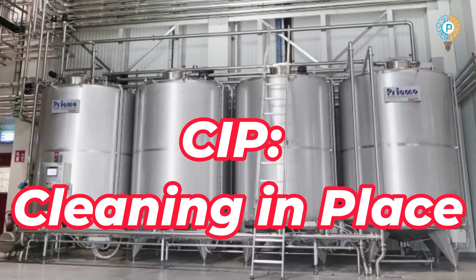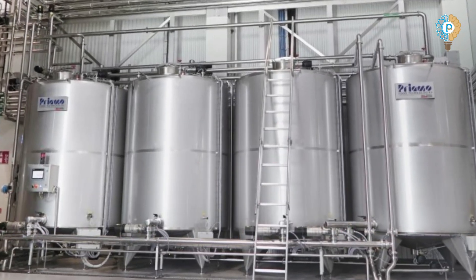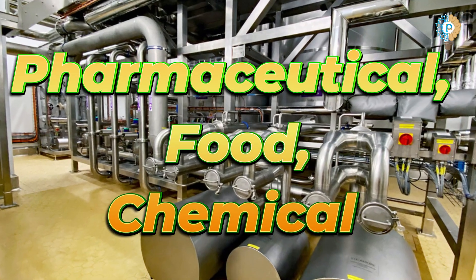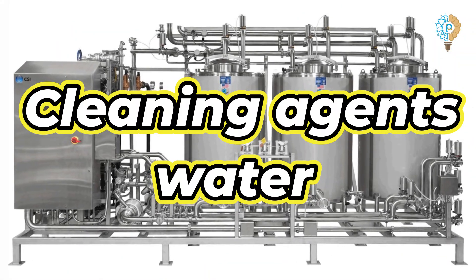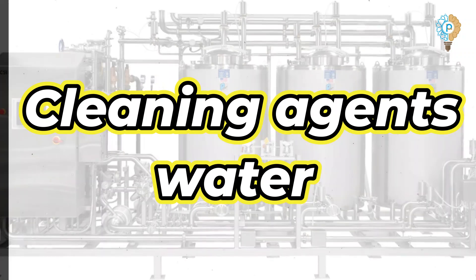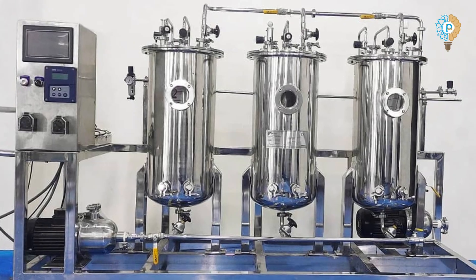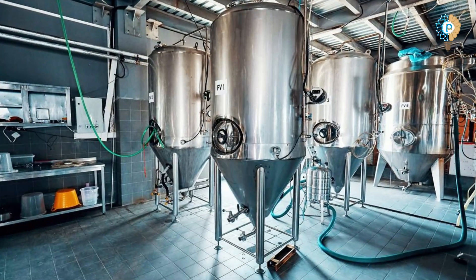CIP stands for cleaning in place. This process is crucial in the pharmaceutical, food, and chemical industries for cleaning equipment without disassembly. Cleaning agents and water are used in the CIP process to reduce time and ensure product safety. Optimizing the CIP process in pharmaceutical industries ensures quality and safety.